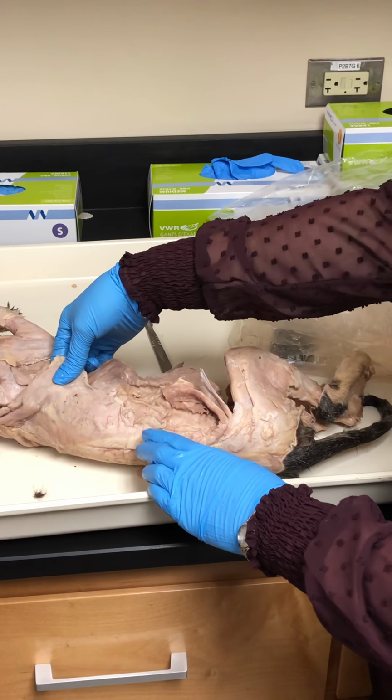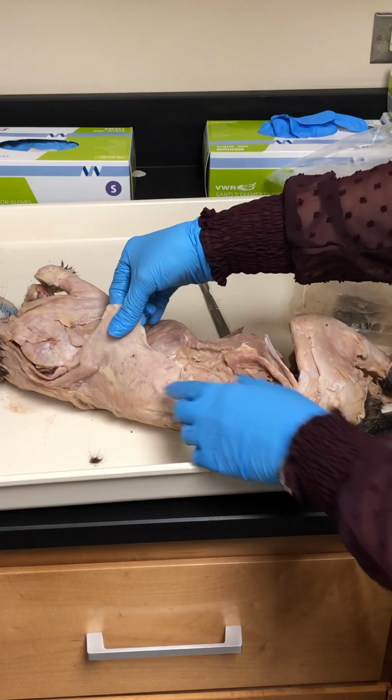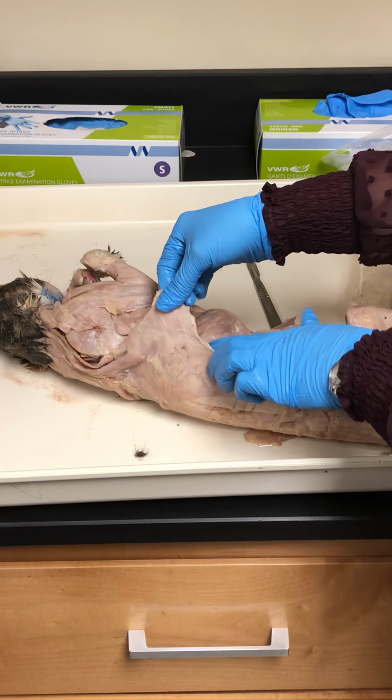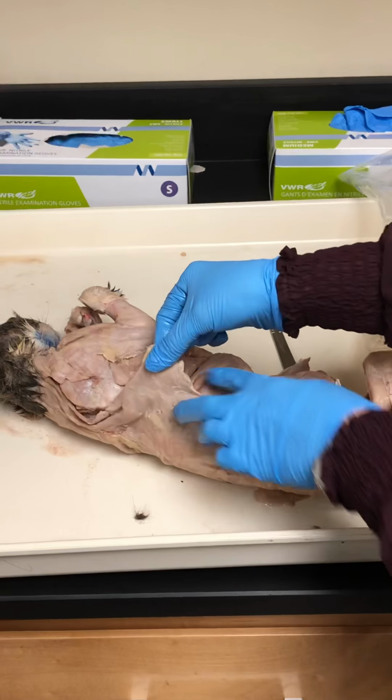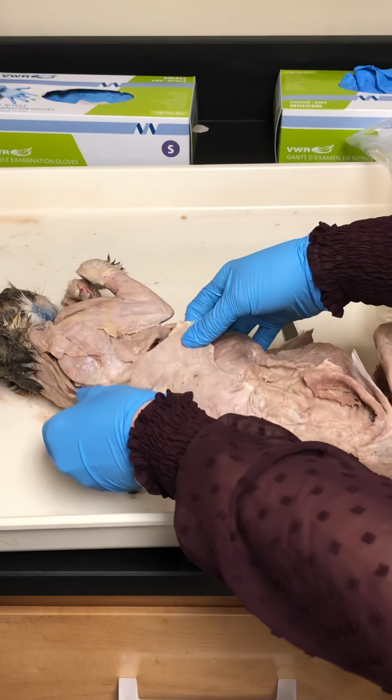All righty. Somebody has to walk me through. Trapezius. Okay, so this was the latissimus. We'll hit that one real quick. That was the lower back, and we had to cut it to get down to some of the deeper muscles. The trapezius is the same.